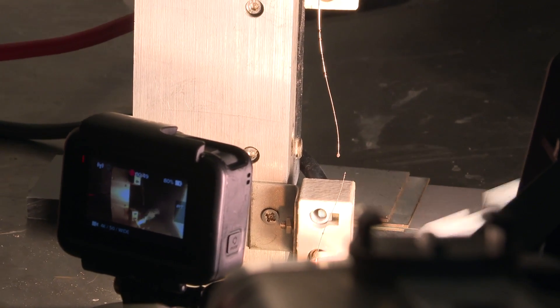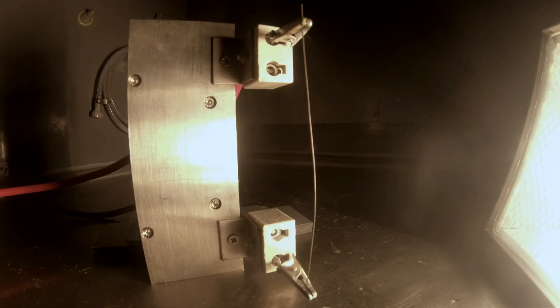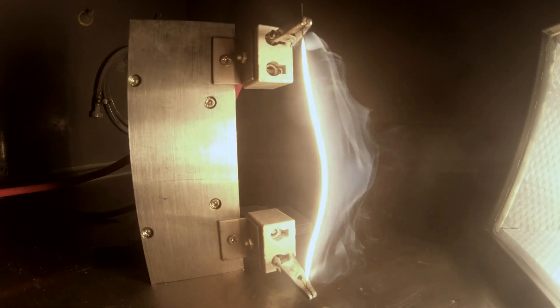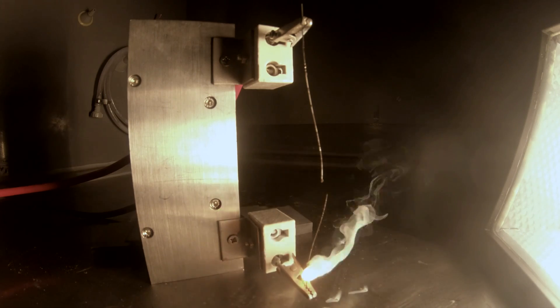And you were right. Instead of getting regular blobs, what happened was the liquid formed and ran down. We got a big blob at the bottom, and a tiny one where the wire had burnt through.